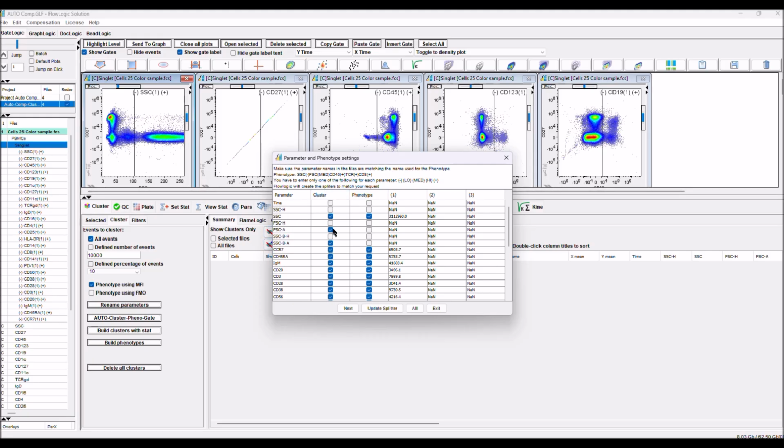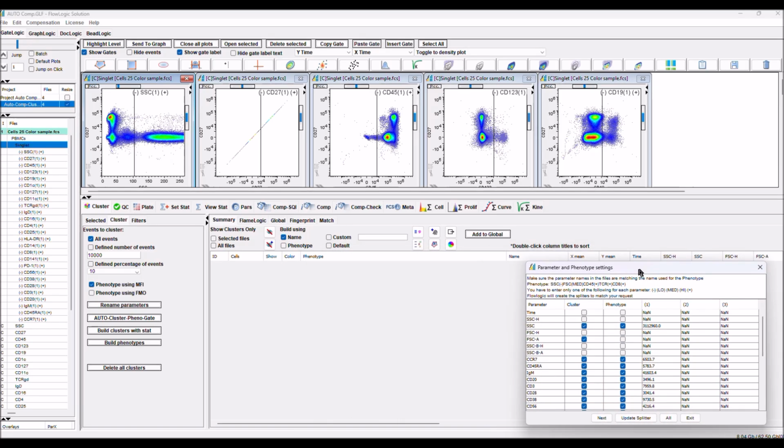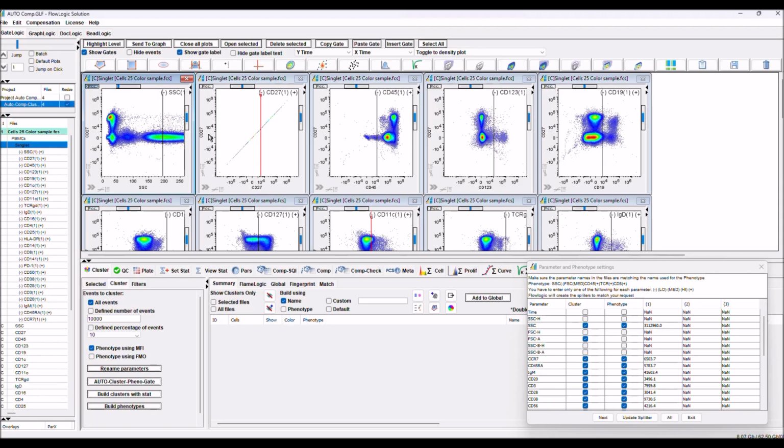This is what we are clustering. We don't need SSC. This is what we don't need, autofluorescence. This is what we are phenotyping. And FlowLogic is already giving you the setting for the phenotype. So we go through and check whether what FlowLogic did sits in the correct spot. So this is for SSC, probably positive and negative.